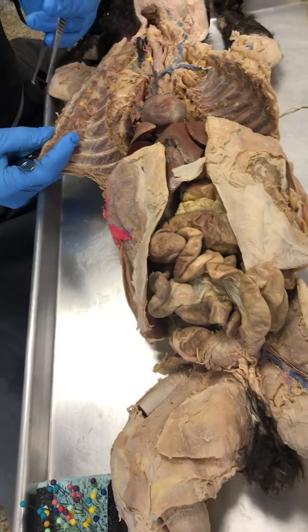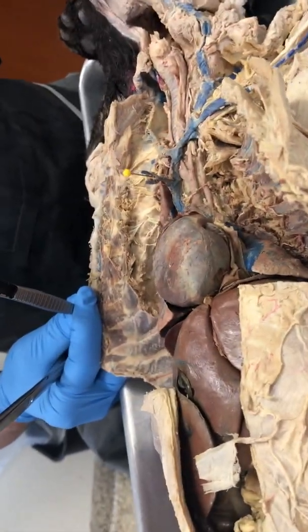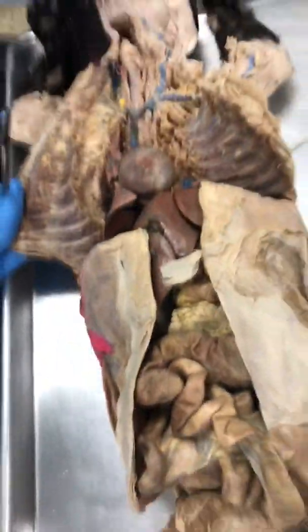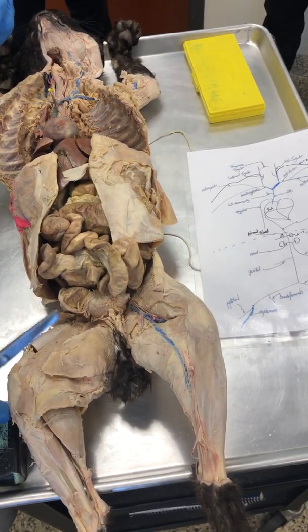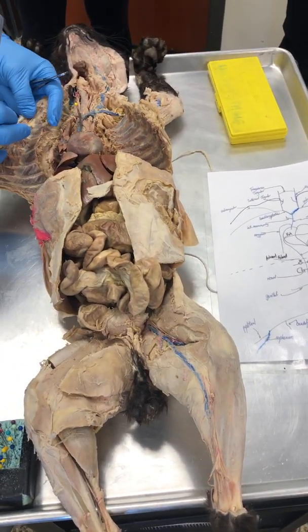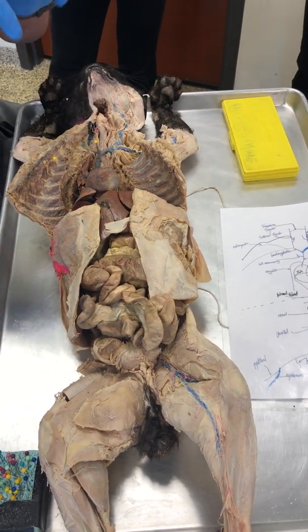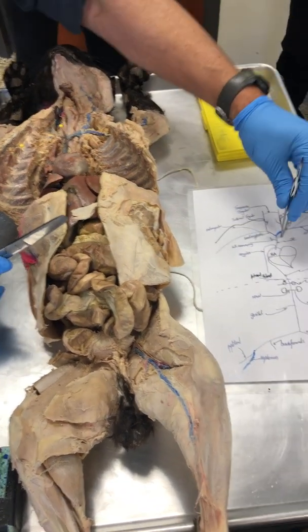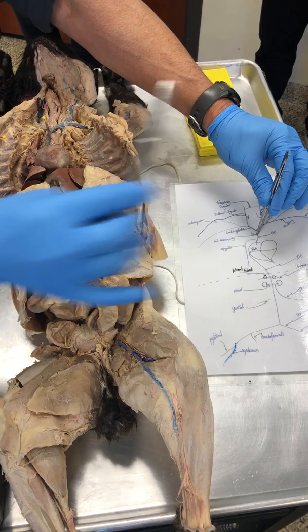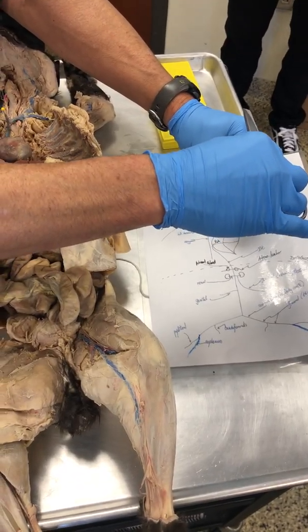It's very small. Oh, the other thing too we see is veins are bigger than arteries. The lumen sizes, veins are bigger than arteries. So there's more blood in a vein than an artery. All right? So all of this is the internal mammary vein, as is all of that. So it's coming from left to right, and it drains down. Notice 2-dimensional. So the internal mammary vein is actually like that. There's the sternum. Yeah? Okay?